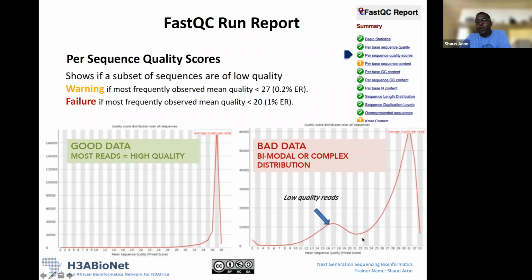And what we can do then, for this particular data set, is when we trim our data, we can say, I don't want to retain any reads that have a mean sequence quality score of less than 30, or less than, say, 25, 26. Through the trimming, we'll remove these ones that obviously have a mean sequence quality score of between 14 and 19. It will remove these reads, okay? So this is one way of interpreting this output. This is the per sequence quality score. It's an overall mean quality score value for all your reads in your data set.